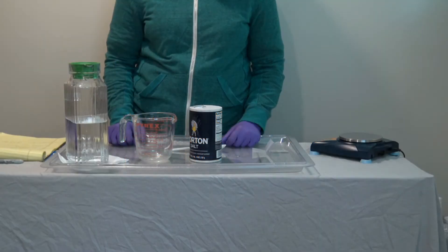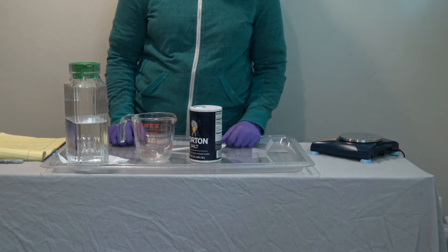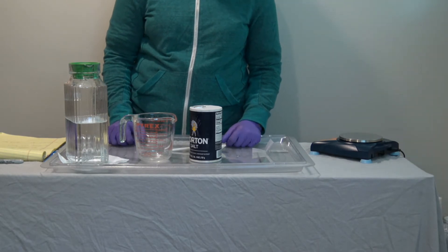In lesson three, groups D and E will be using salt water in their chemical process. You will need to prepare 400 milliliters of salt water solution per class.